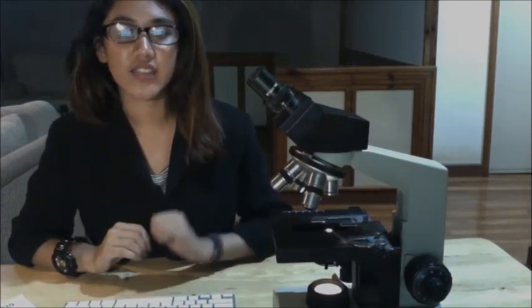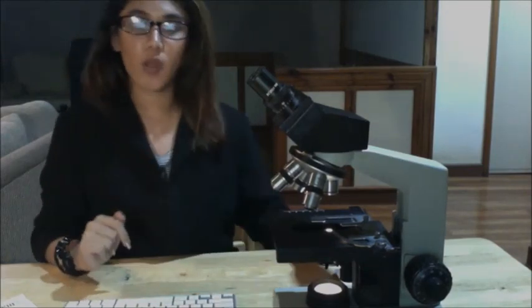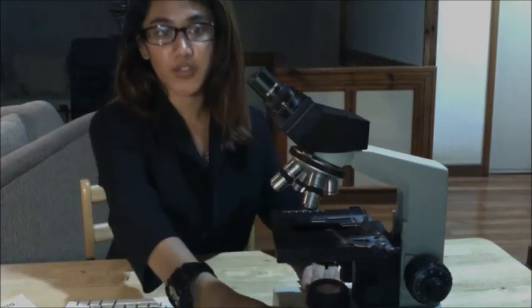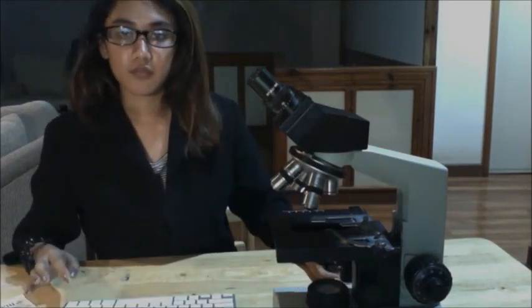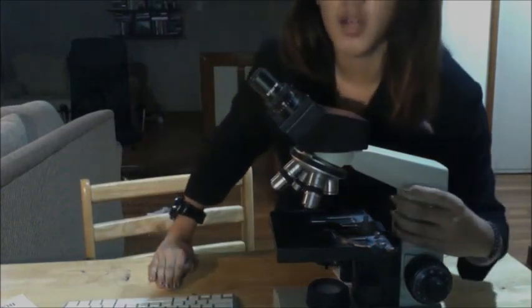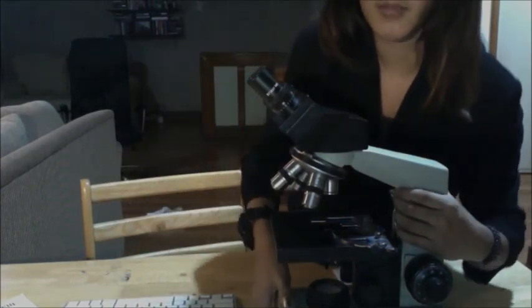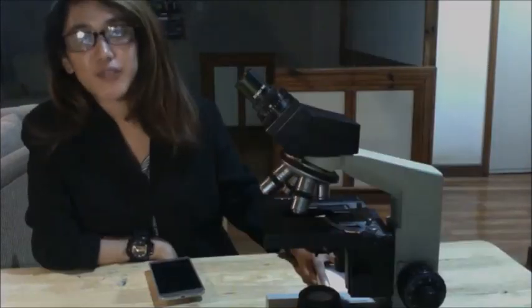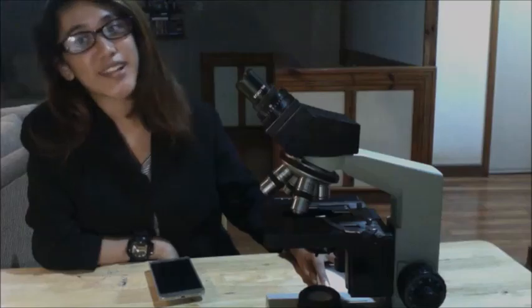Remove the slide and then clean off the slide and the stage using your lens paper or Kim wipe. Never use Kim wipes on your objective lenses. And then after that, you can now turn off the light. And when carrying a microscope, always use two hands. You need one hand on the arm and the other on the base. So, like this. Now, we have come to the end of this video. I hope it helps. Bye!